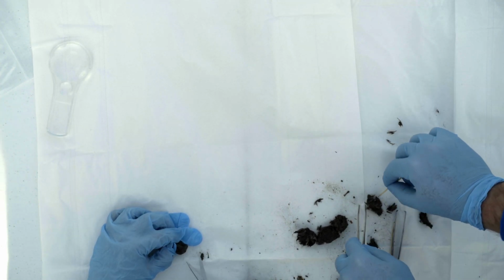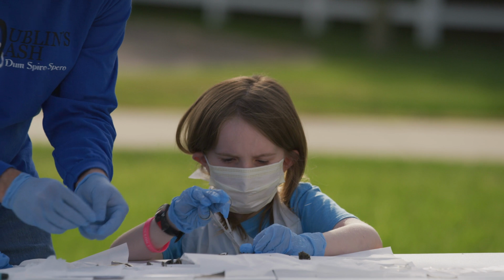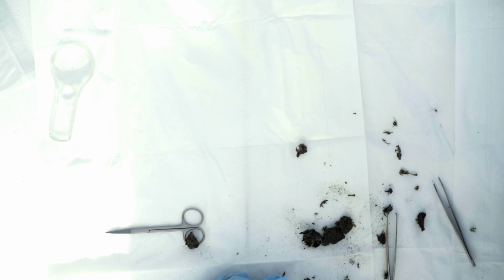We have another bone right here. Okay, I'm going to move to the side and move this stuff out of the way. There's some more bones in here. There's a head. Okay. Here's a bunch more fur. Let me get this out of the way, and I'm going to put this back in front of the camera. Got some more bones here. More bones? Yep. Excellent.